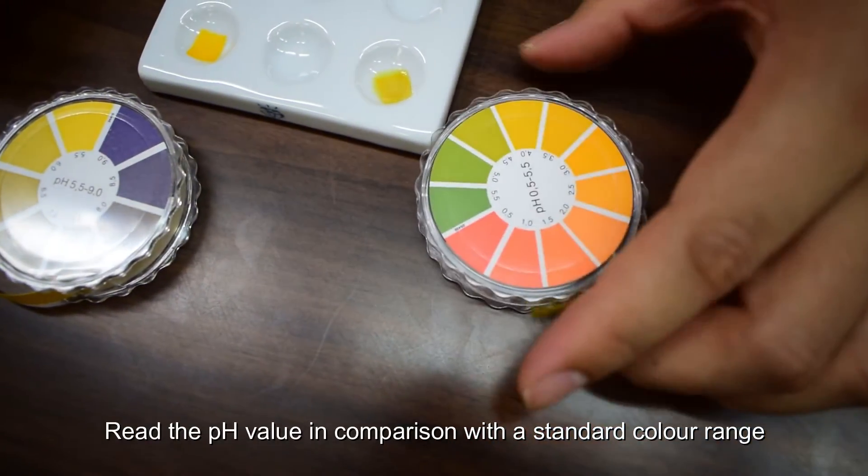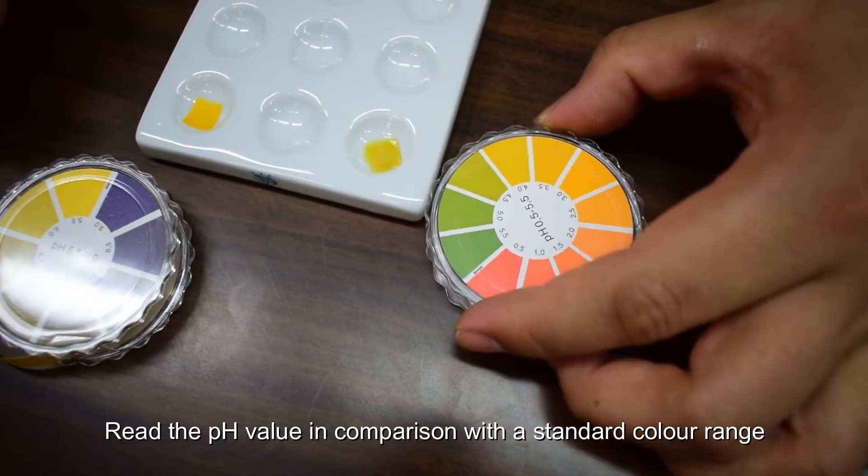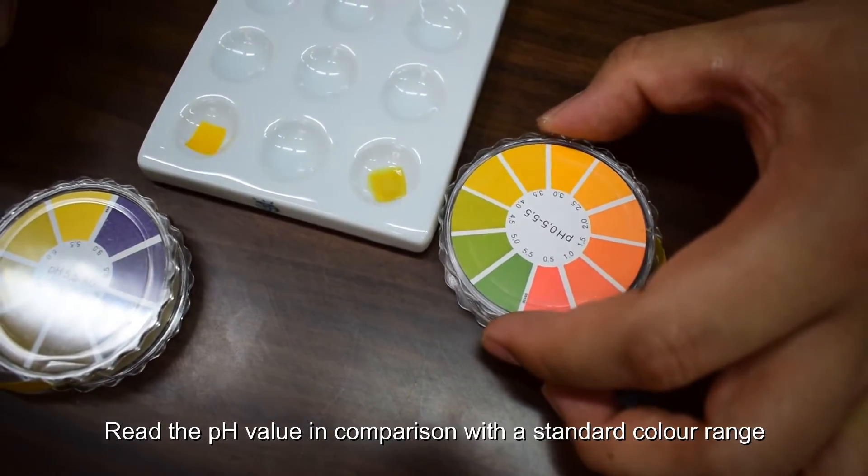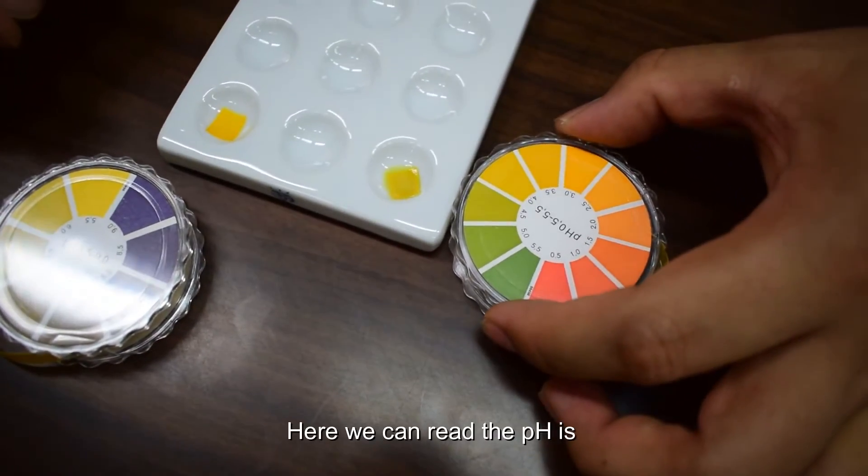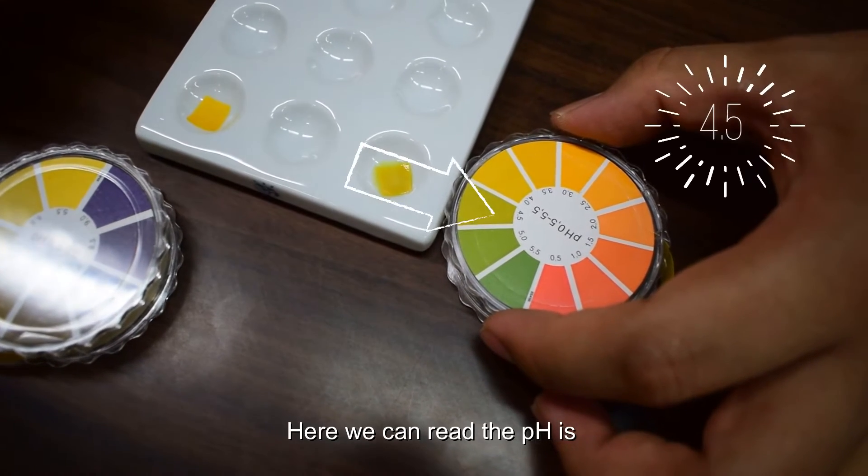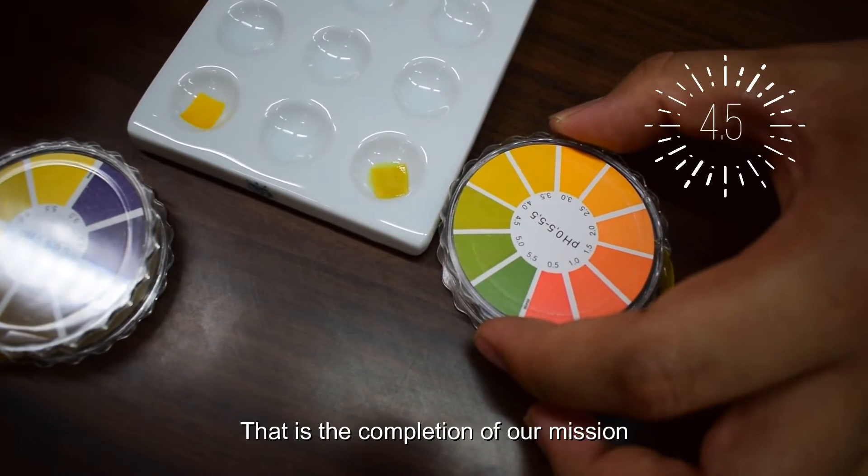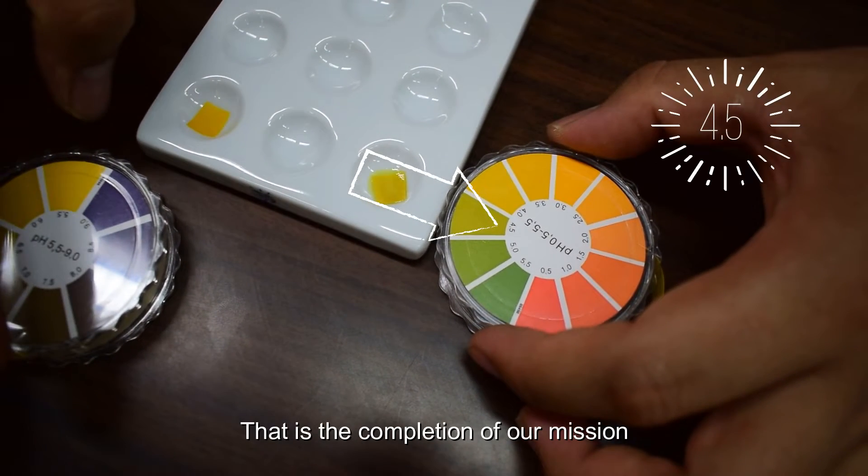Read the pH value in comparison with a standard color range. Here we can read the pHs. That is the completion of our mission.